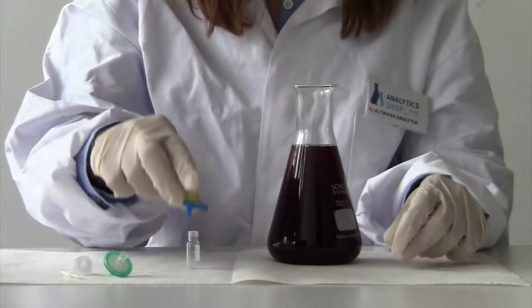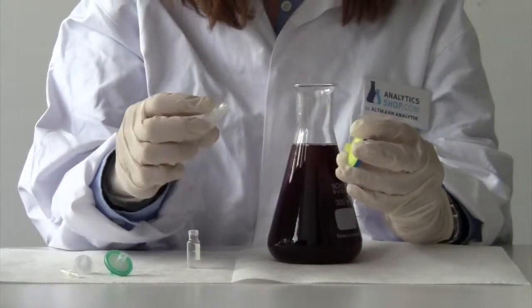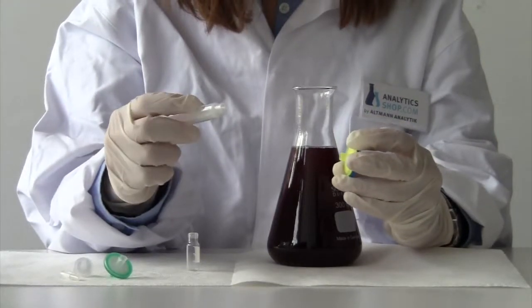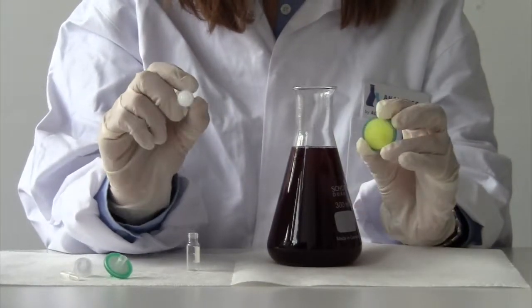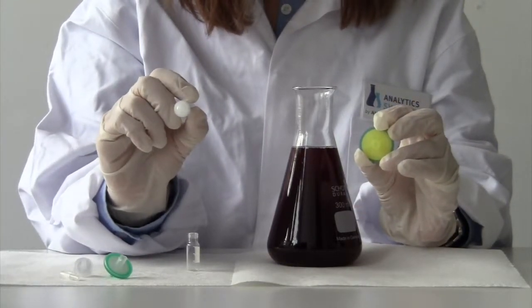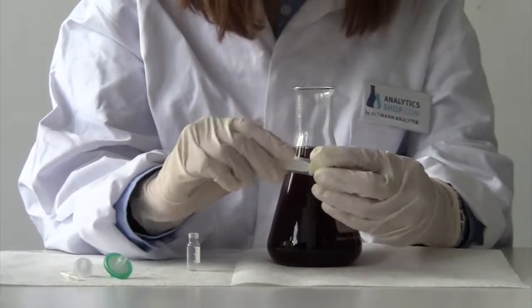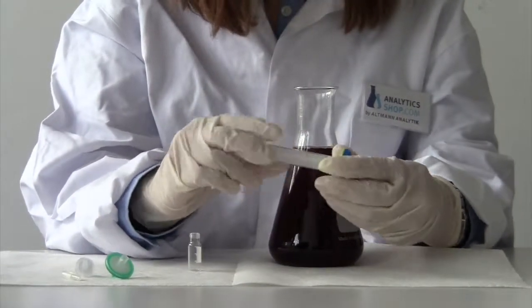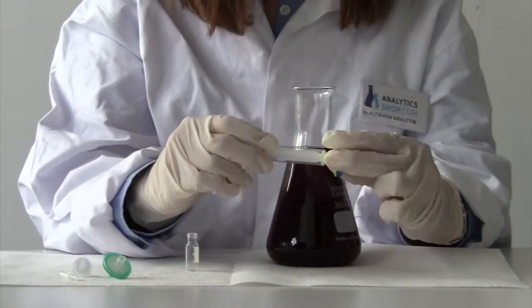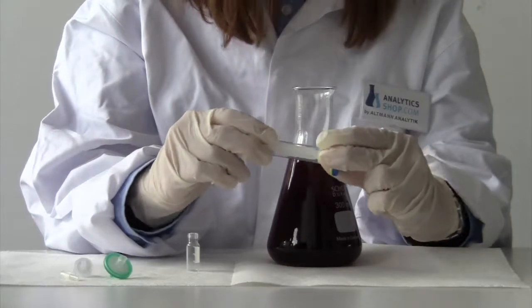If the sample is especially viscous, we recommend the usage of a Luerlock connection so that the syringe filter does not come loose during pressing.